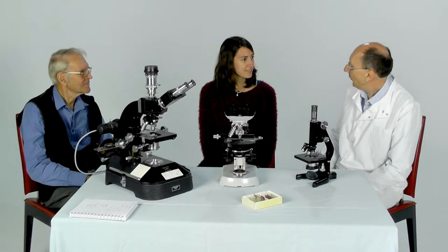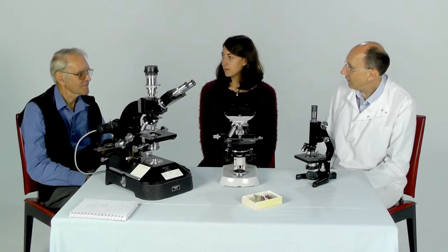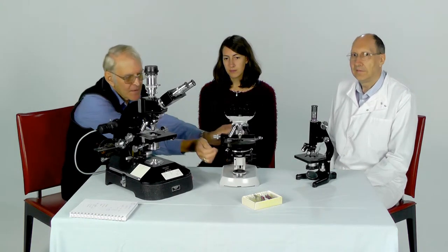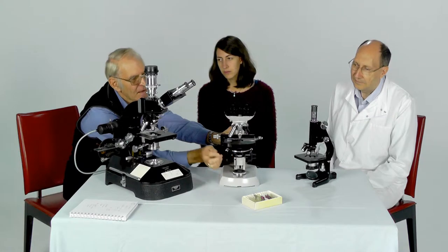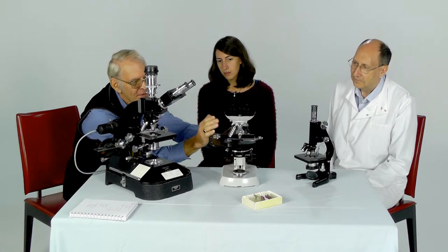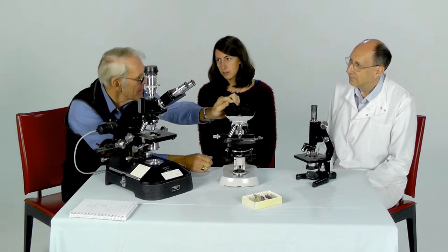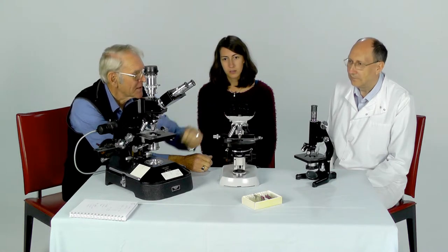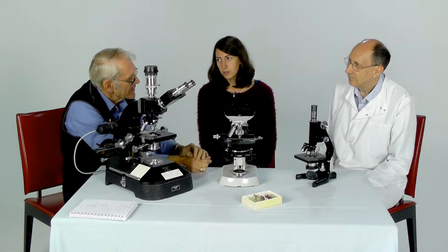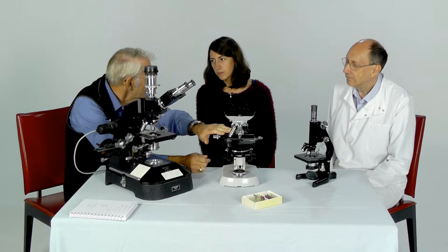So in this video we're going to talk about the lenses on the microscope. So what are the key lenses, Louis? We have the condenser lens system, but the main image-forming lenses are the objective — the set of objective lenses — and the eyepiece lens or lenses. The objectives usually come in sets, and there are different magnifications in the range.